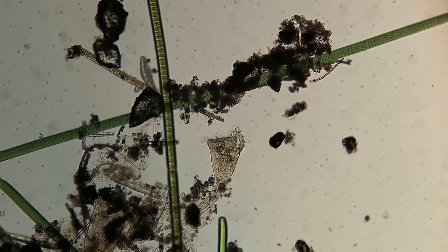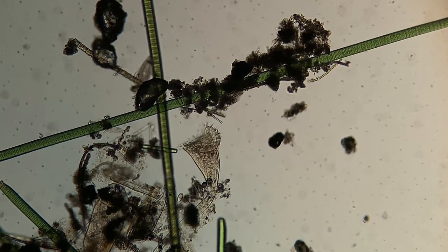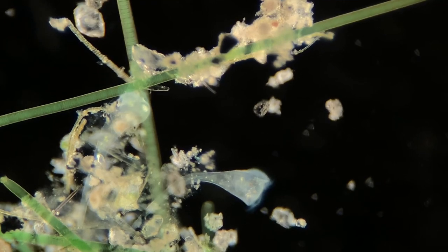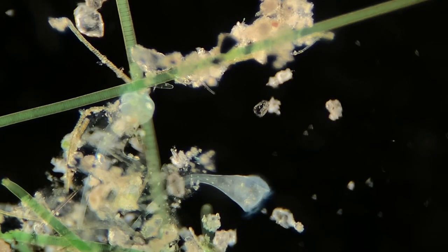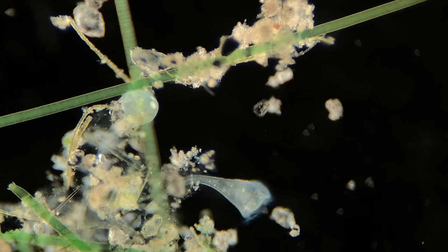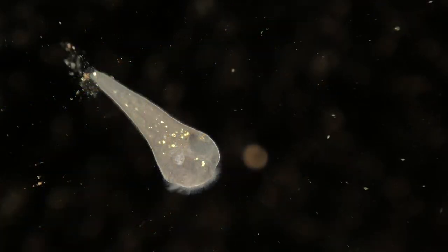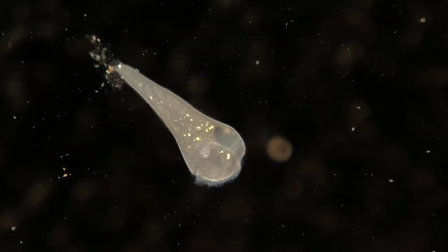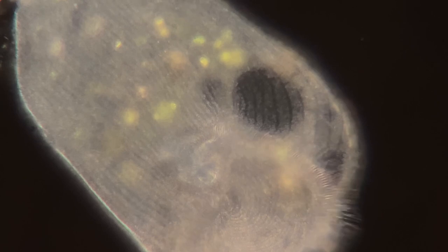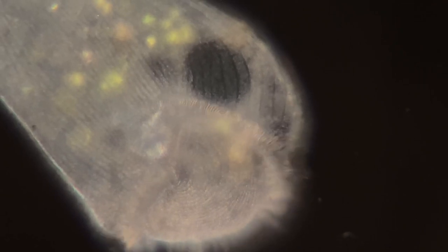On these guys I found these single-celled organisms called stentors. Stentors are really cool because they are really large — they're some of the larger single-celled microbes you can find. In fact, the gastrotrich that I showed you at the beginning of this video is actually smaller than all of these stentors, which is kind of crazy to think about. The gastrotrich is a multicellular organism with muscles and a simple brain, but these stentors are single-celled, composed of muscle-like fibers and organelles, not quite organs.